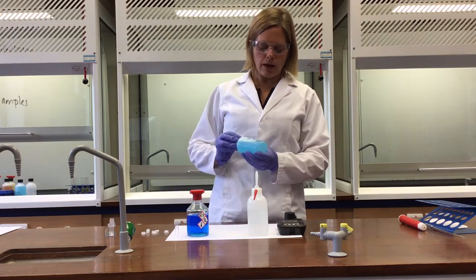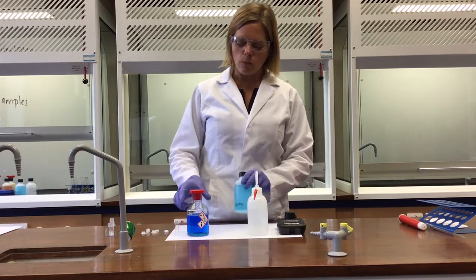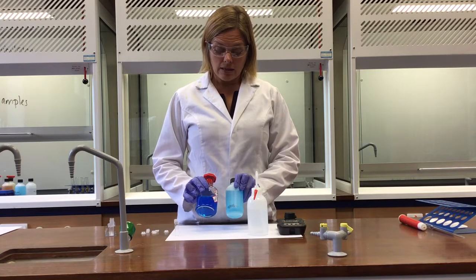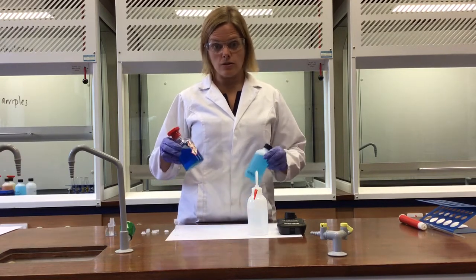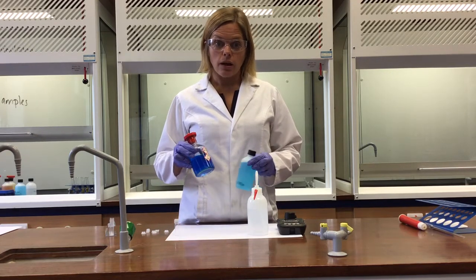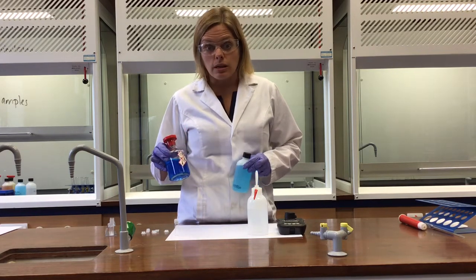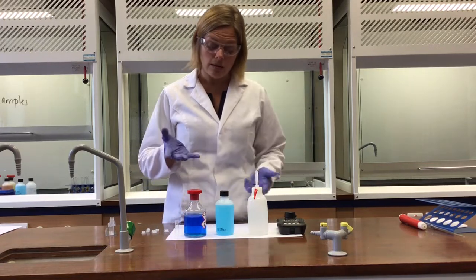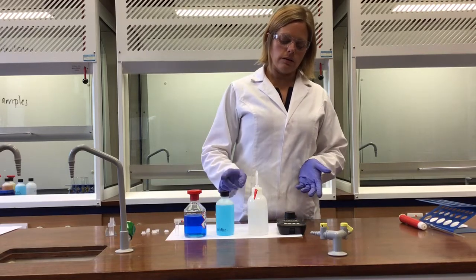In this bottle, I've got an unknown concentration of copper(II) sulfate, but I think it's a lot less than 1 molar because, if you can see, it looks a lot paler in colour. And indeed, as the concentration of a particular chromophore, in this case the transition metal ion in solution, increases, then the depth of colour increases as well. In other words, more light is absorbed in that sample and less light is transmitted through it. And we can use that in order to try to work out the concentration of the unknown in this bottle.